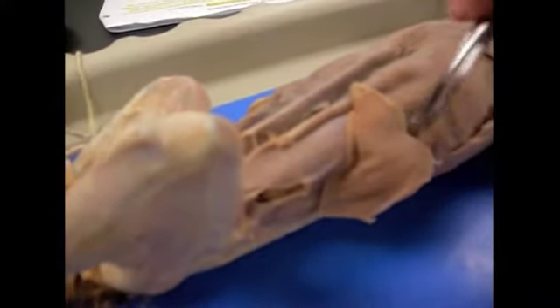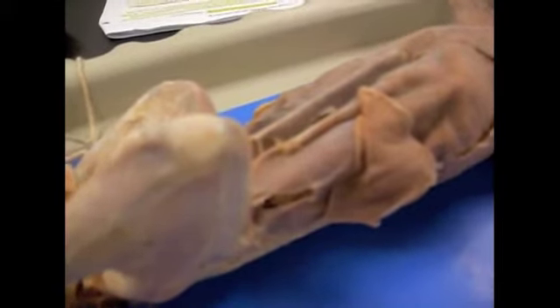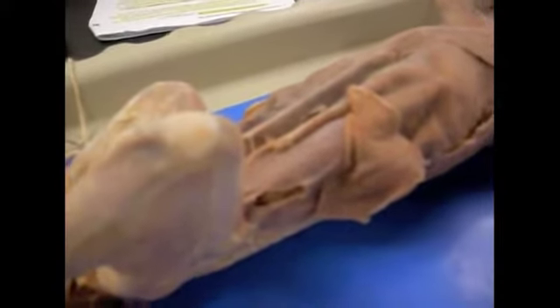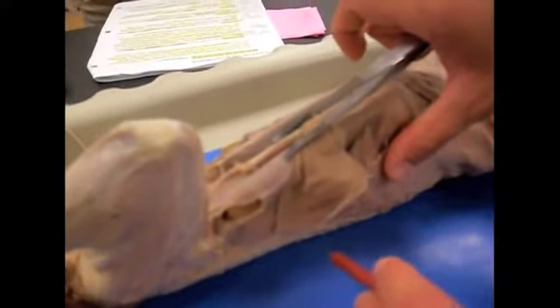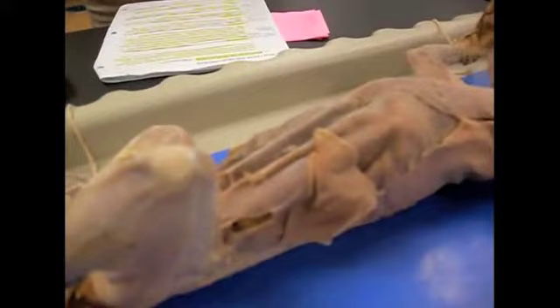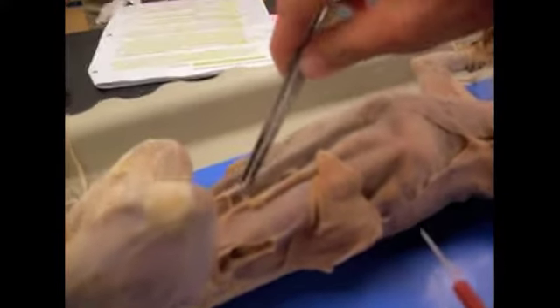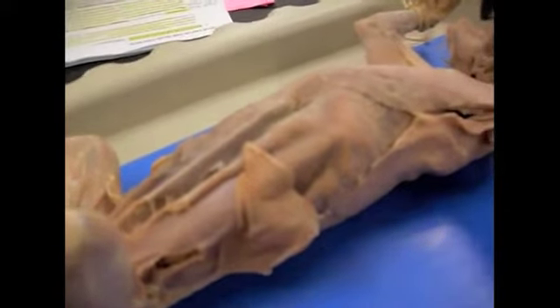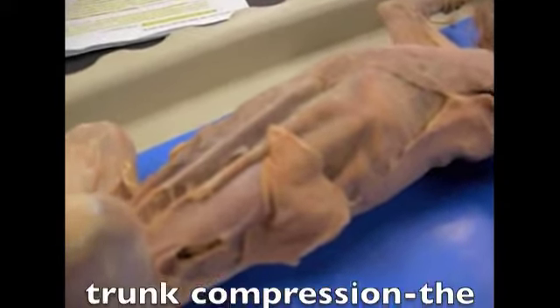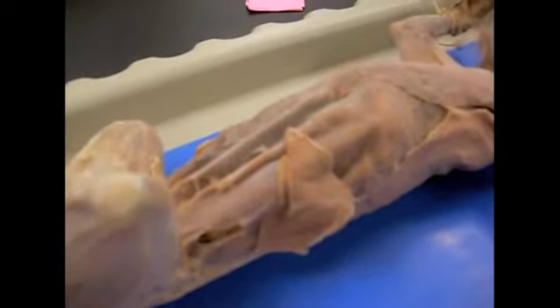This is your external oblique. It originates in the posterior of the ribs, and the lumbodorsal fascia, which is an aponeurosis on the dorsal side, which is under the cat, kind of hard to see since it's tied down. It inserts upon the aponeurosis on the mid-ventral side of the cat, which is right here, and an aponeurosis connects muscle to muscle. That aponeurosis is called the linea alba. And the function of the external oblique is trunk compression.